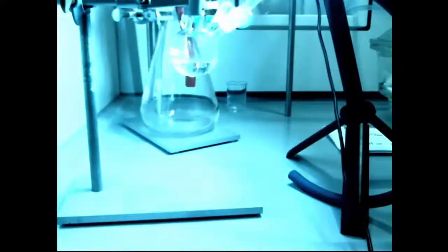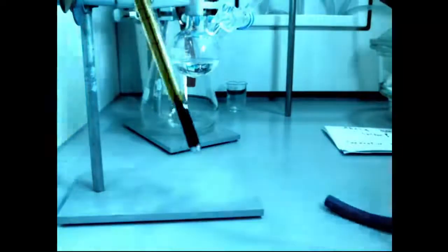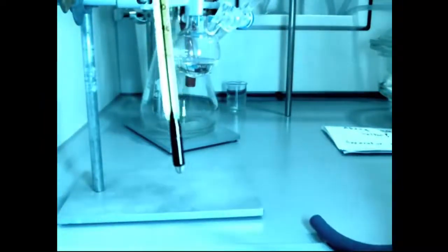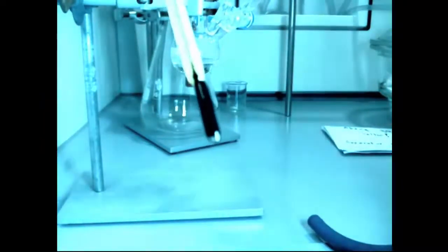So I'll put a thermometer in there and try to measure the temperature. Now I've let it back up to room pressure. Speeding up this bit as well as it's cooling down the thermometer, and we can see the temperature is 10 degrees centigrade in there, and it was boiling the methanol. Okay, it was at very low pressure, but methanol shouldn't boil at that temperature.